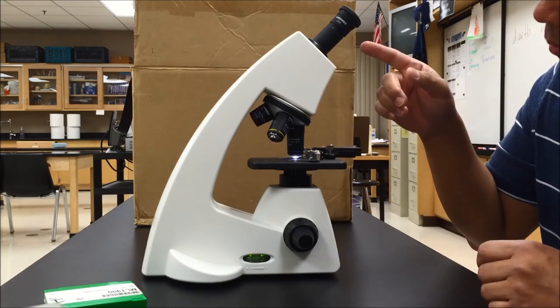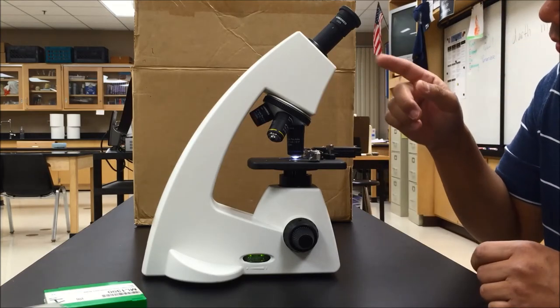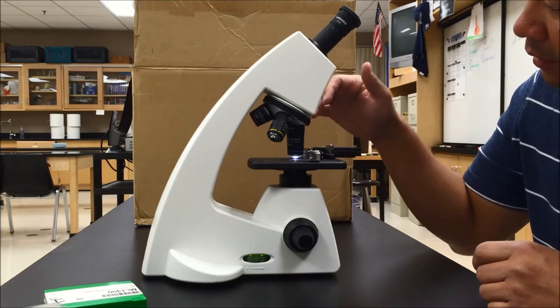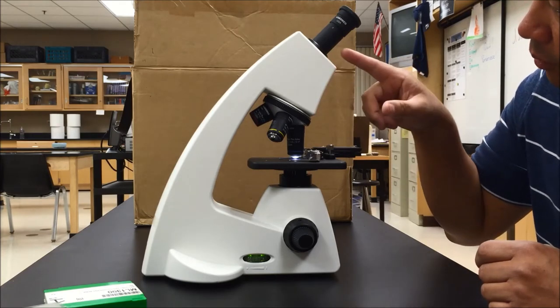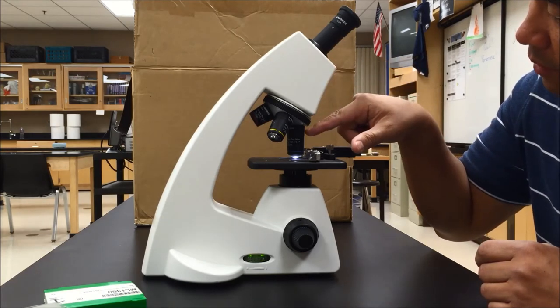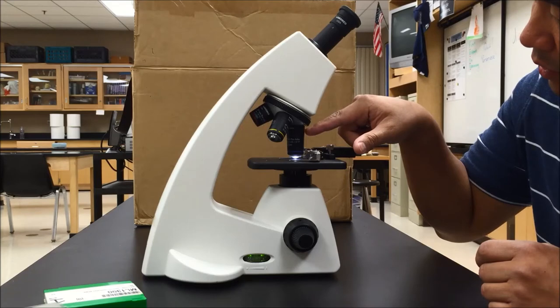To find the total magnification of a specimen on your slide, you have to multiply the eyepiece magnification times the objective lens magnification.